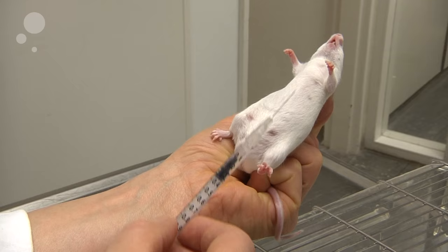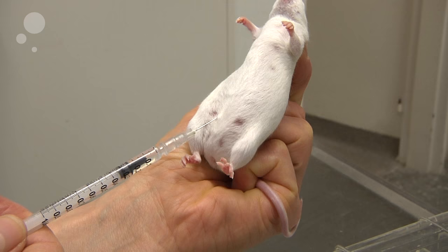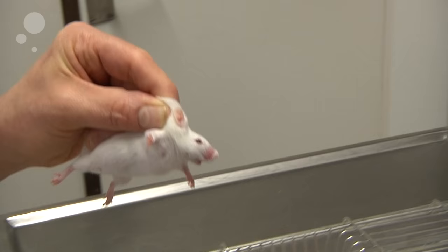Then you will do your injection in the right quadrant of the mouse abdomen. Gently introduce the needle, draw back a bit to make sure you're in the right position, and then gently inject your fluid. Draw back and put it back into the cage.